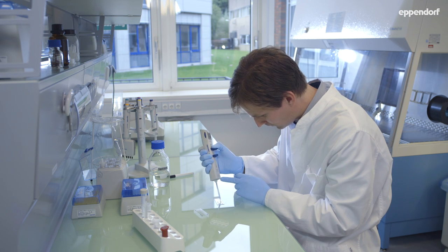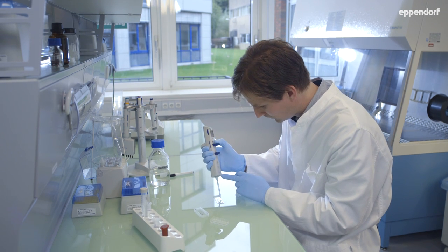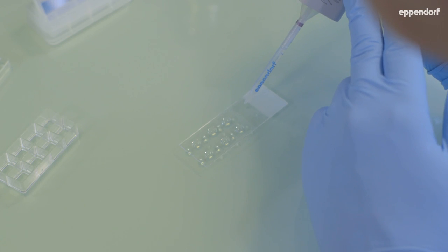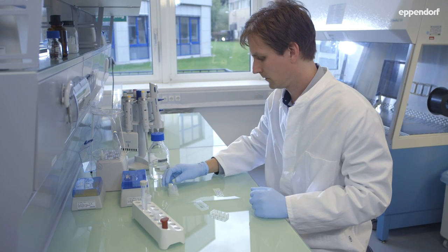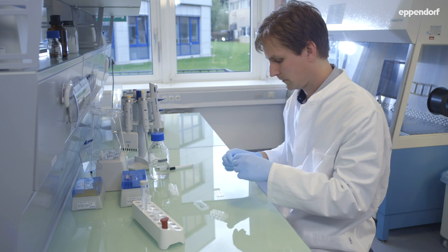Add a drop of mounting medium on each well. Place the coverslip onto the drops. Be careful to avoid the formation of air bubbles.